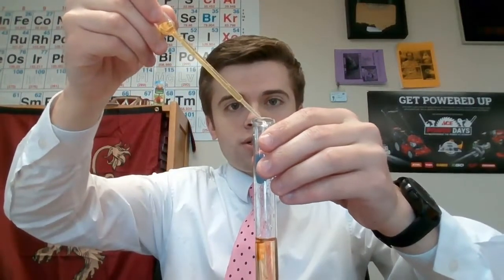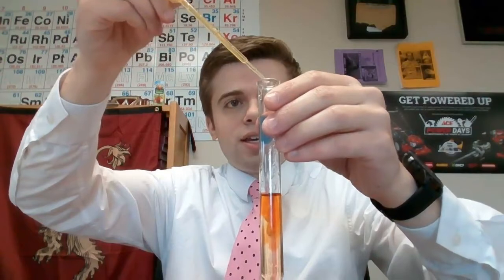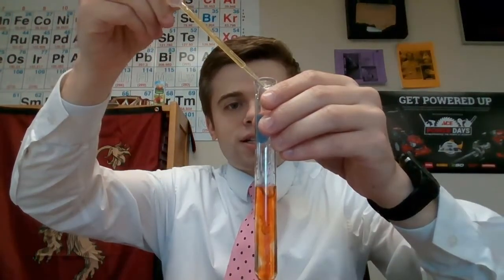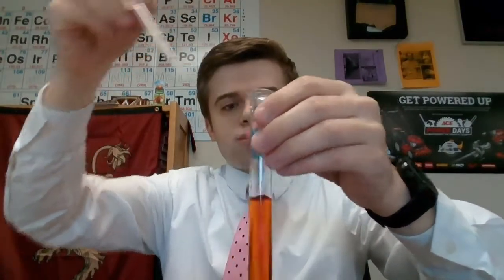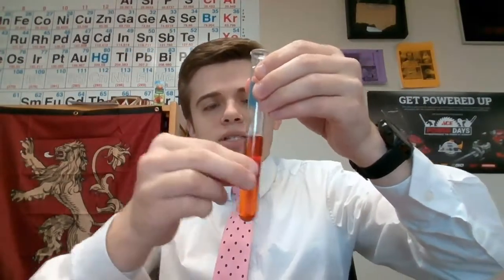I'm going to do 1, 2, 3, 4, 5, 6, 7, 8, 9, 10, 11, 12, 13, 14, 15, 16, 17. Oh, we'll do a little bit extra just for good luck. We're going to flick it nice and good, and we want to see what happens.